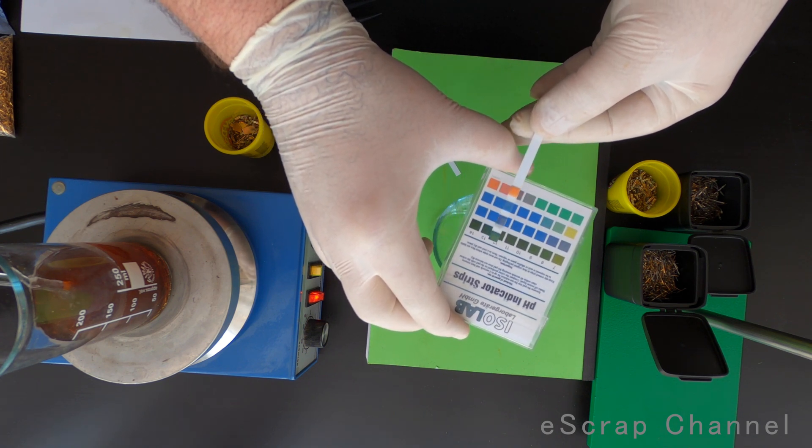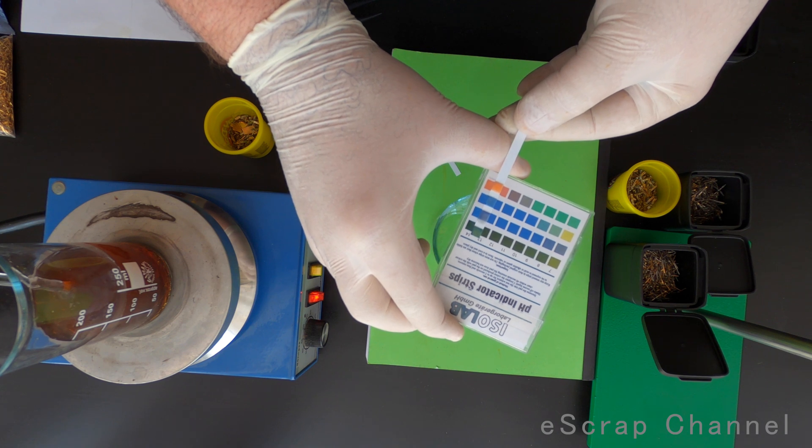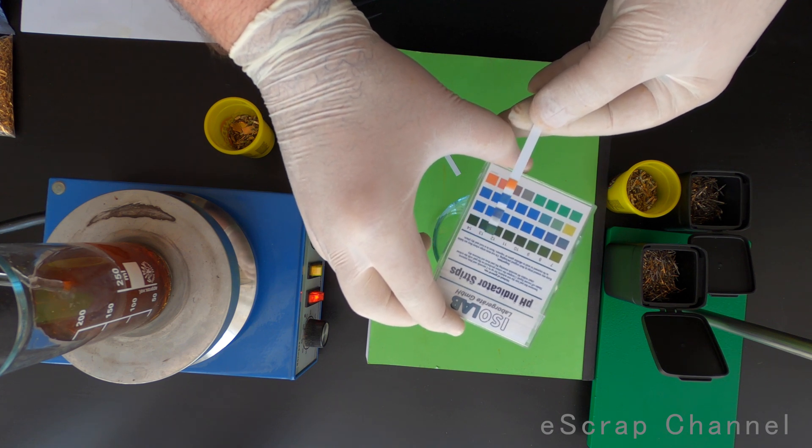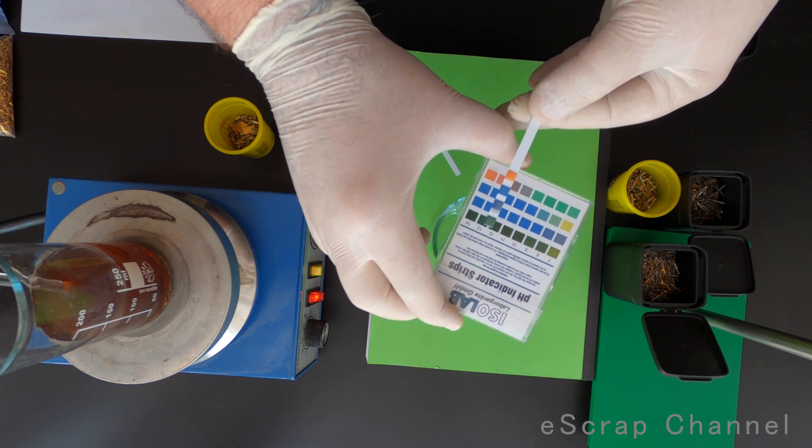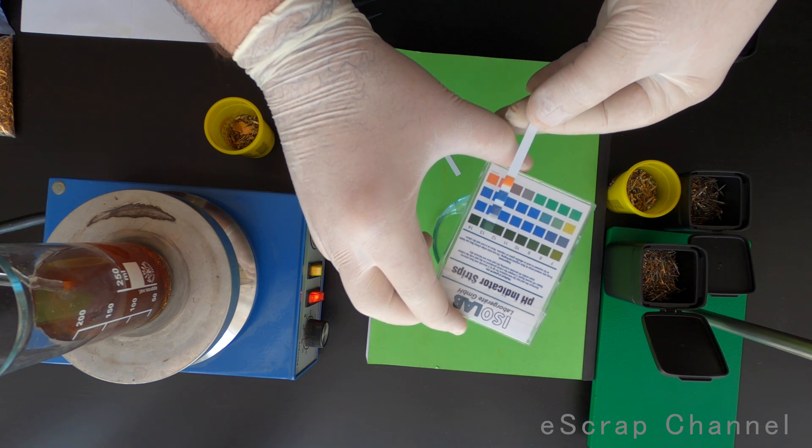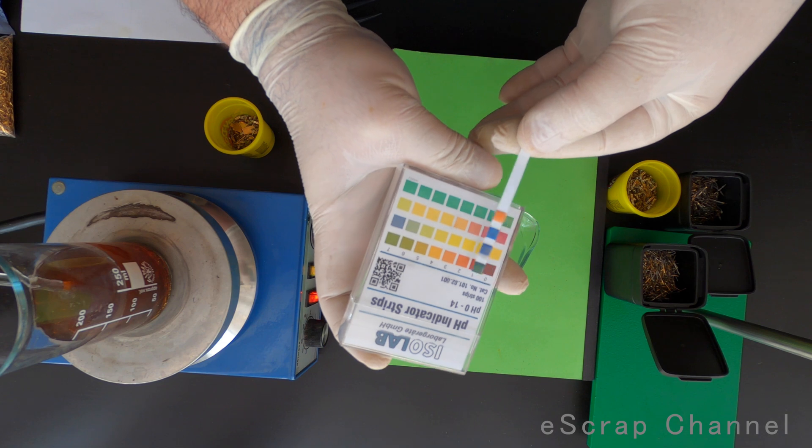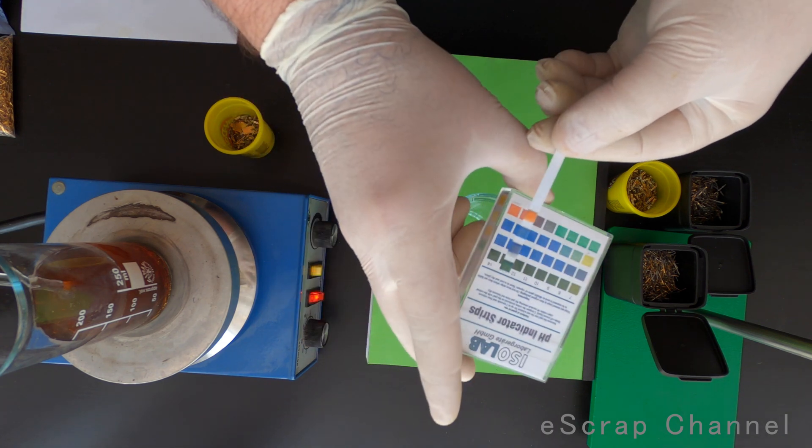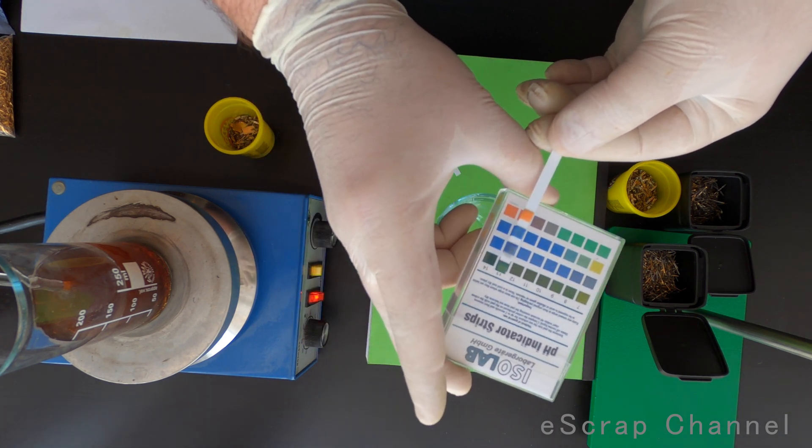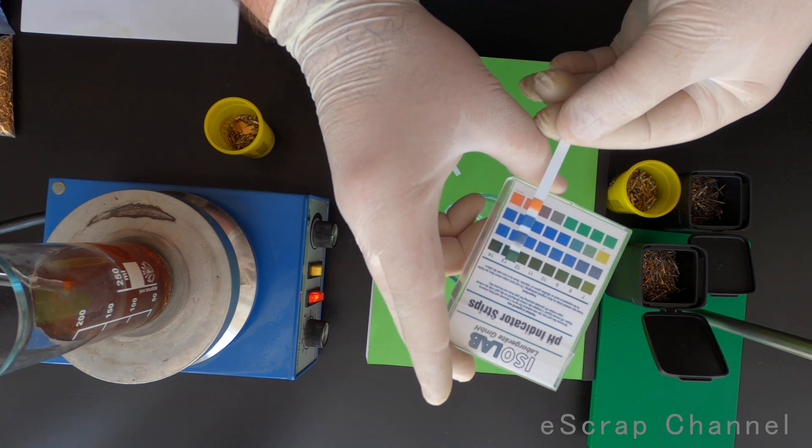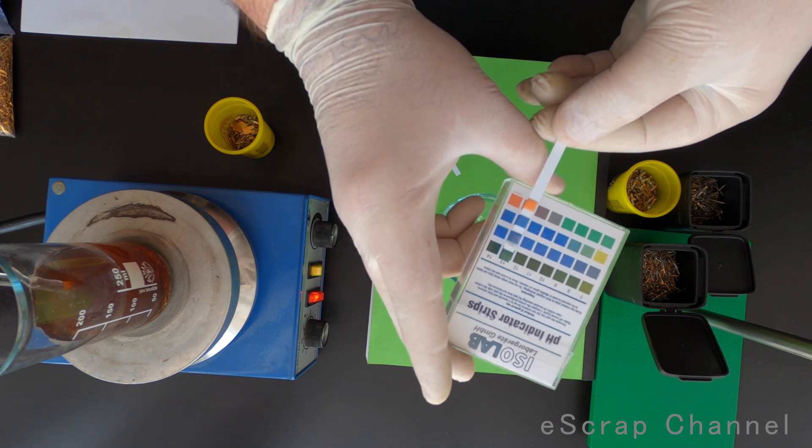In this case, I find it at about 14. So it looks like a strong alkaline solution that we have. I can show you the other ones. It matches the highest pH possible. It's 14.